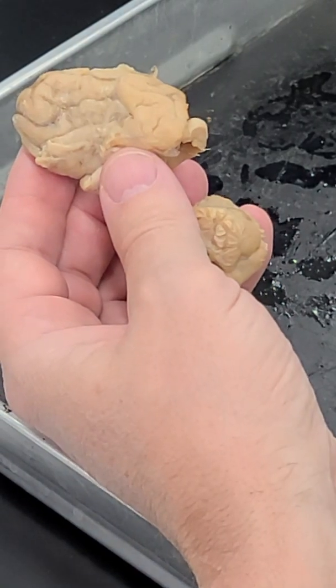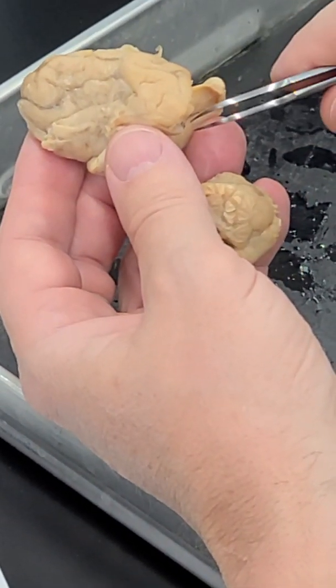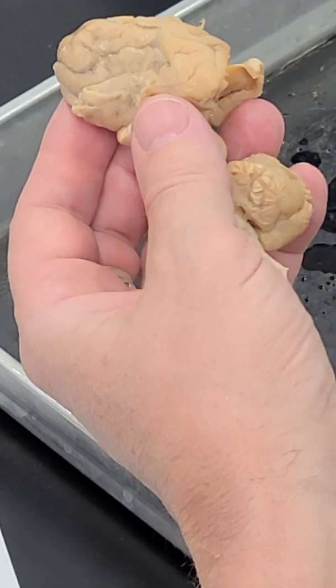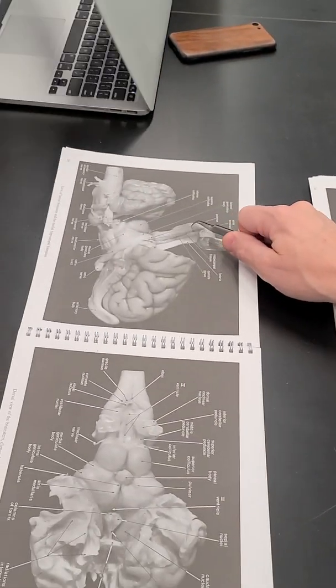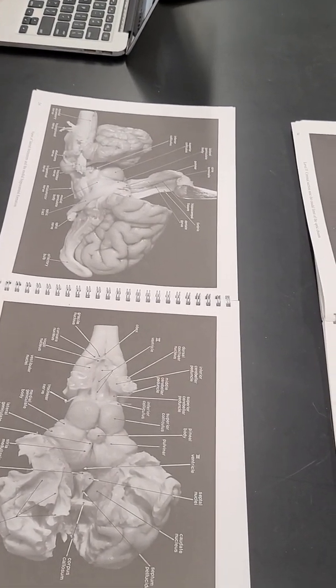And the hippocampal fissure separates the dentate gyrus from a structure right next to the hippocampus proper called the subiculum. You don't have subiculum labeled on any of these, I'm sorry, but you can see this tissue right here is subiculum, and then that is attached to the entorhinal cortex.